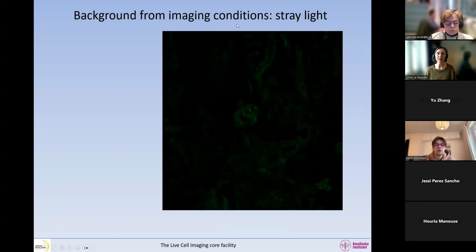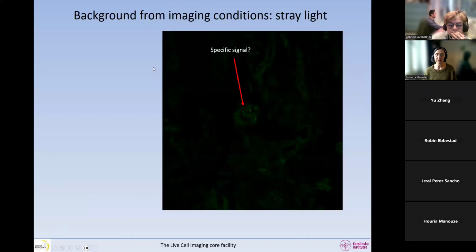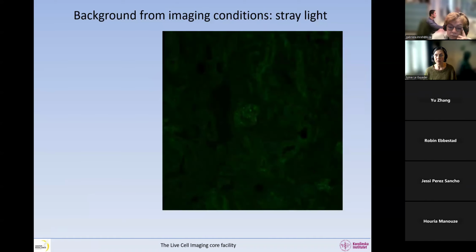And the background can also come from the imaging condition. And one thing is stray light. So for example, we have this image. Is this a specific signal? Well, let's have a look at this little time lapse of the thing. Wow, what's going on in there?